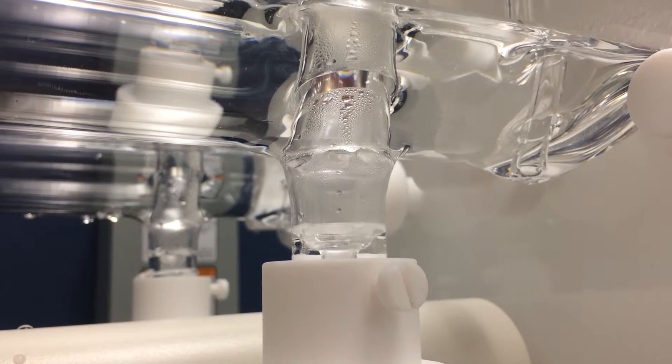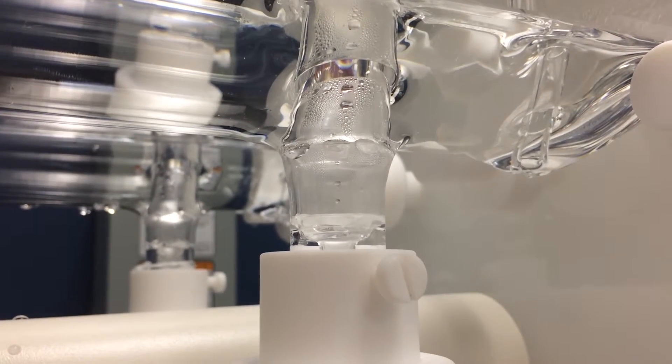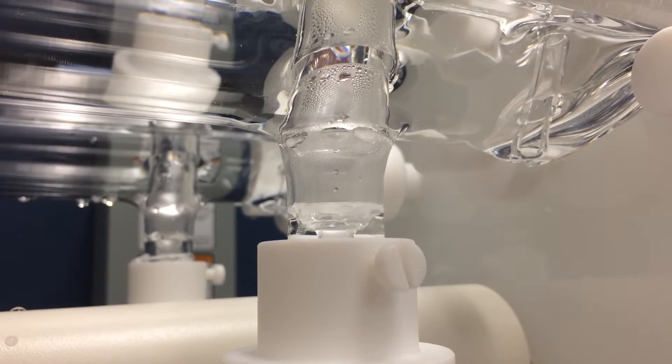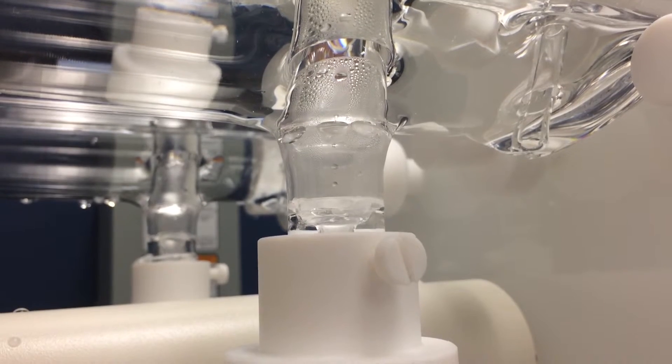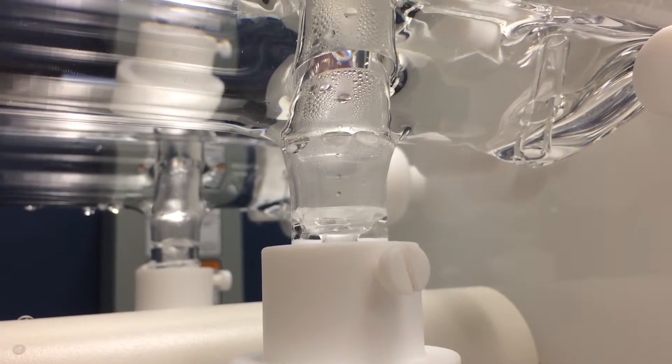After several minutes you will notice some condensation in the distillation chamber indicating that the distillation has begun. The liquid will slowly start to collect in the reception flask.